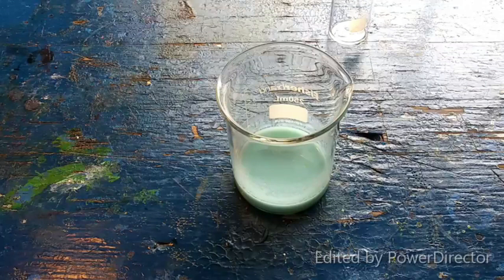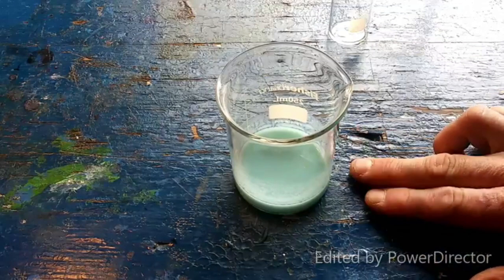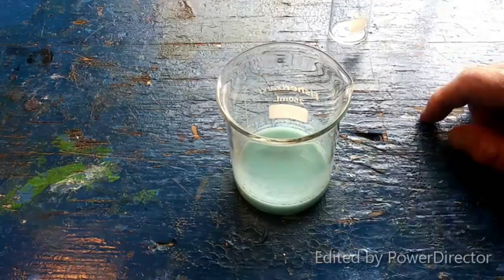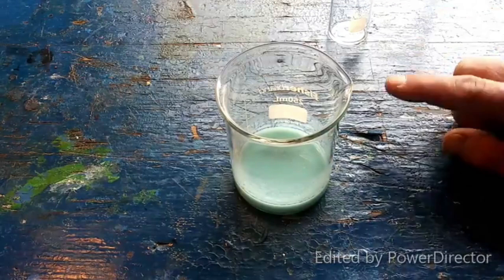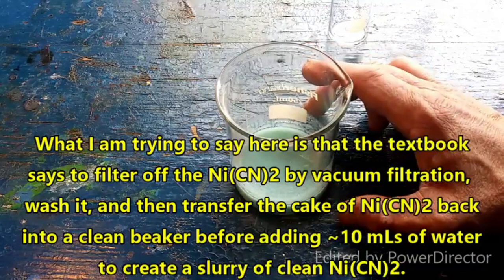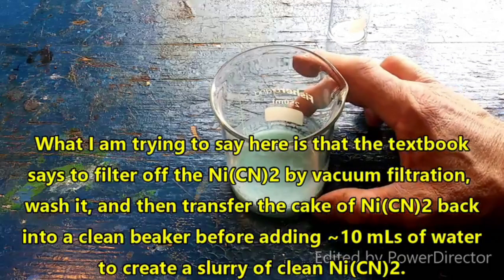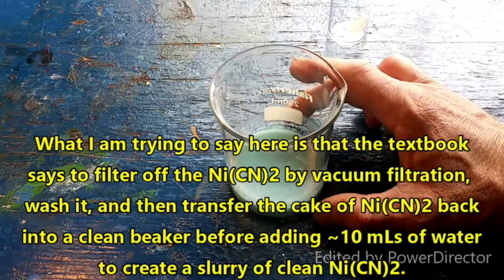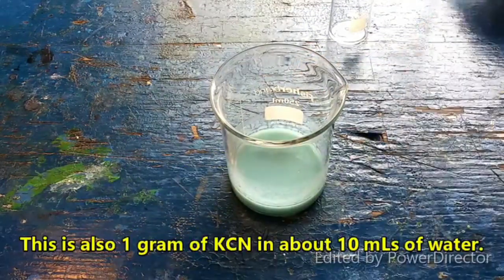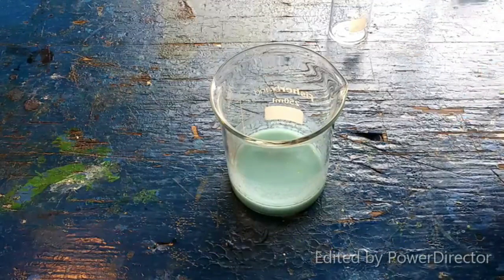Alright, now the protocol says to filter this off and wash it with a few small portions of deionized water, of course using distilled water here, and then once we've got it, we're supposed to take it out of the funnel and transfer it back into the beaker, create a slurry with this, and then add in another solution of 1 gram of potassium cyanide in order to create potassium tetracyanonickelate.